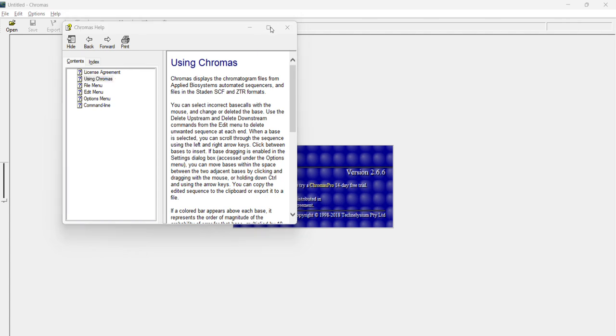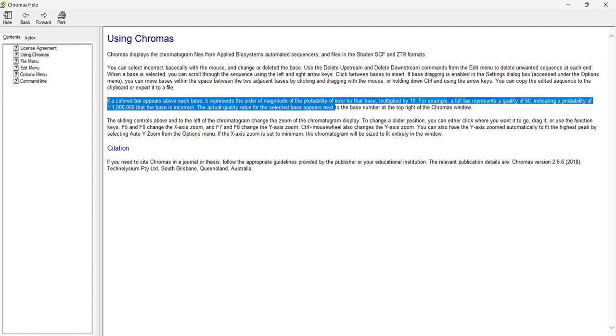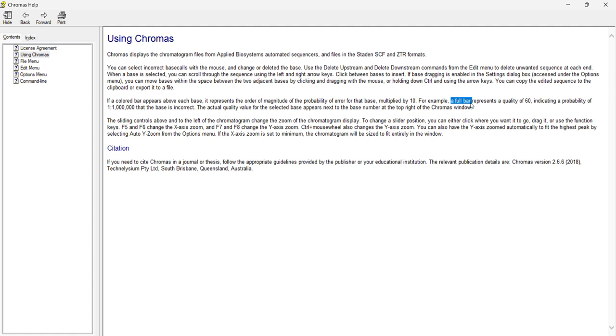So here is the definition, I guess. In the software you can easily find it, so you can read it very easily. It says if a colored bar appears above each base, it represents the order of magnitude of the probability. When we start reading the data, we'll get to know how and what to read. So basically, if the bar is full, the color is full, we'll get to know the quality of results. If the bar is full, the probability of its incorrectness is 1 in 10 lakh, right? So it's quite good, right?